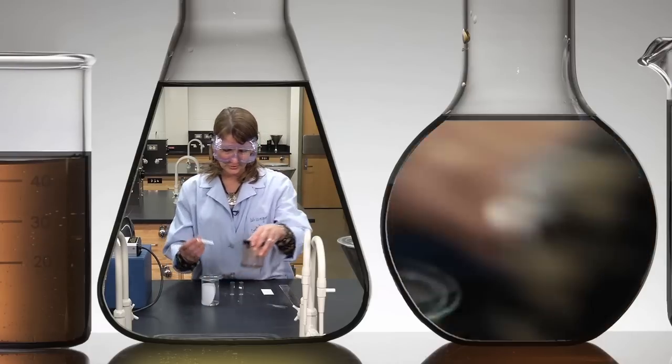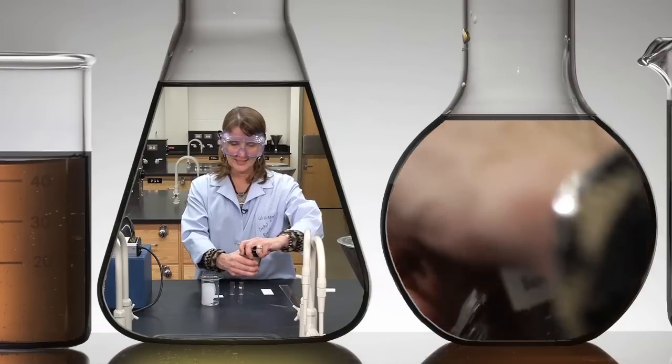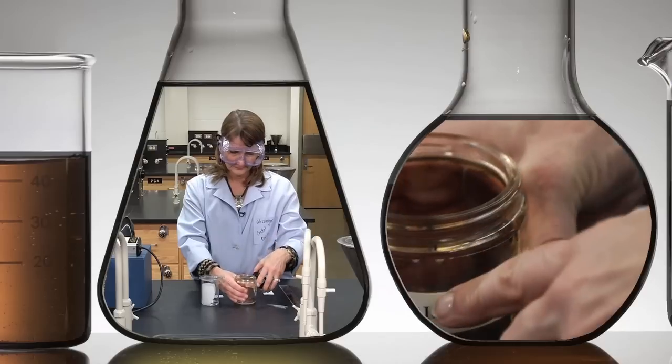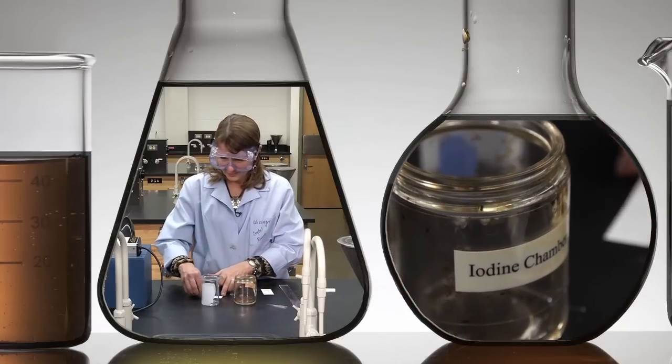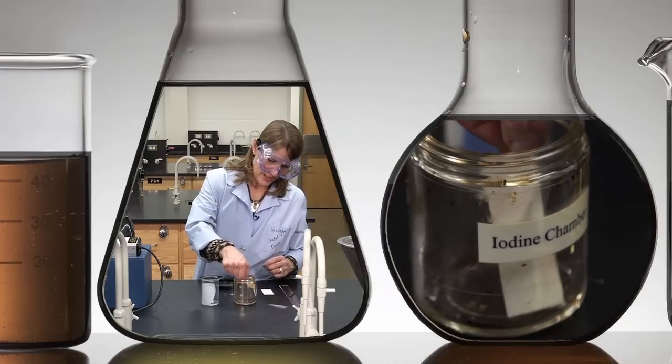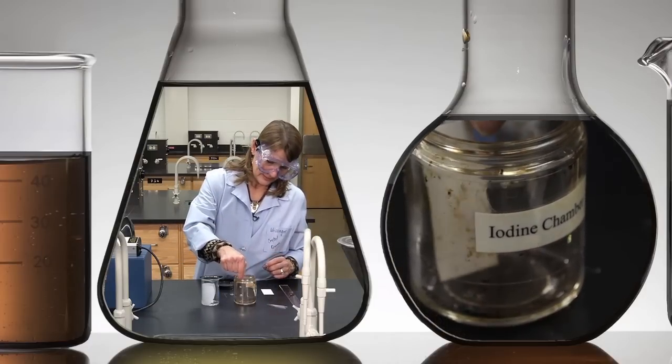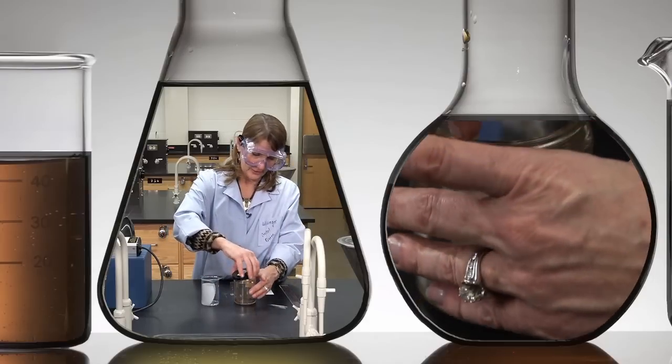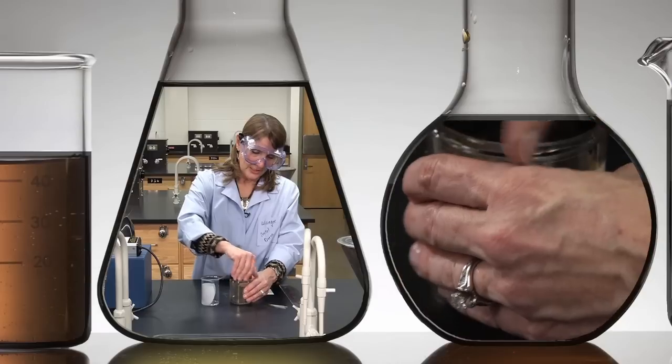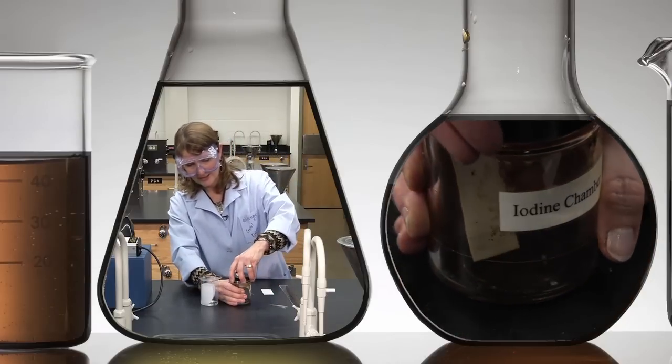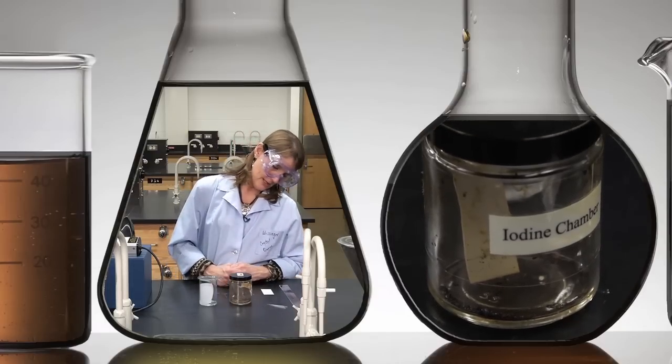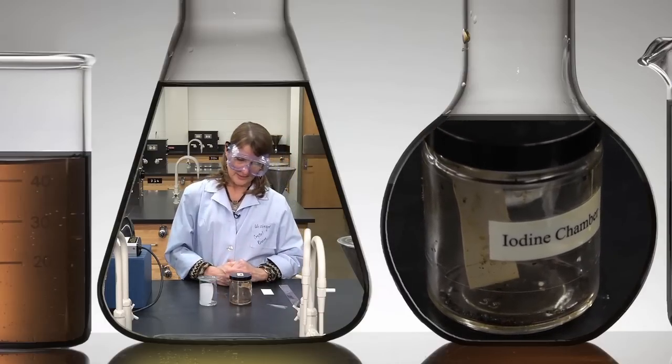Now I'm going to visualize it with the iodine. The iodine will react with any polar or pi bonds present in the molecule. You can increase the rate of the iodine interaction by putting it on a steam cone and warming up the iodine chamber.